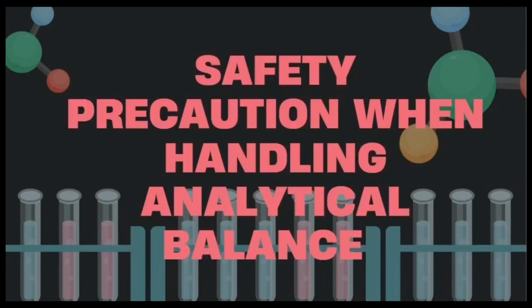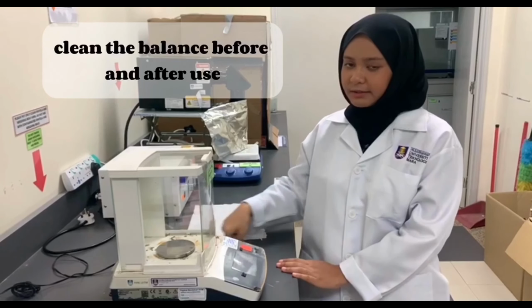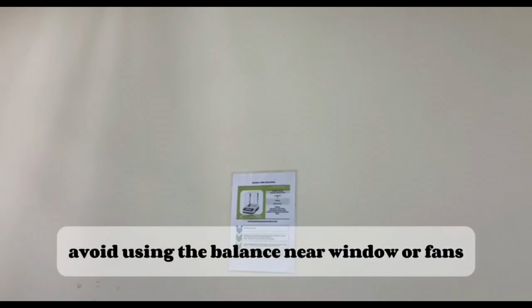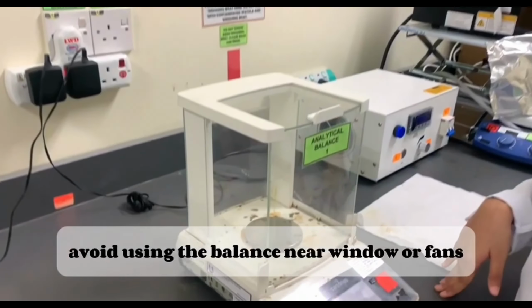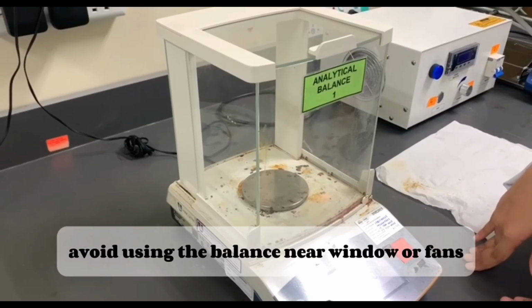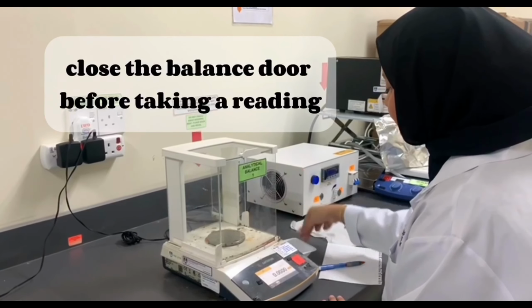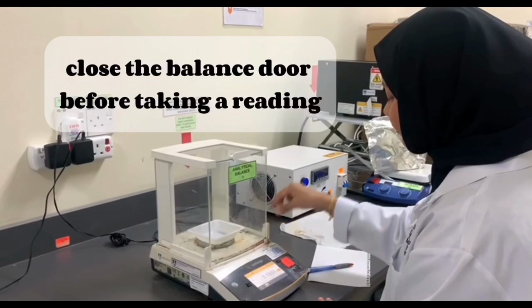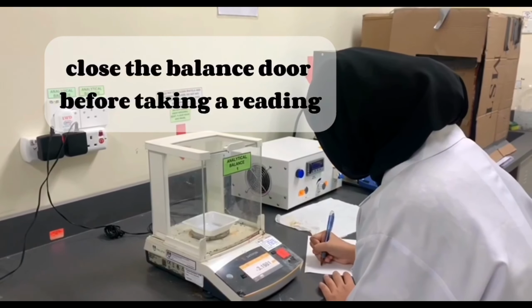First, let's take a look at safety precautions when handling analytical balance. Make sure to clean the balance before and after use, such as removing dust, powder or any chemical residue. Avoid using the balance near windows or fans because air movement can disrupt the measurement. Please make sure to close the balance doors before taking a reading because even small air currents can affect the reading due to the high sensitivity of the device.